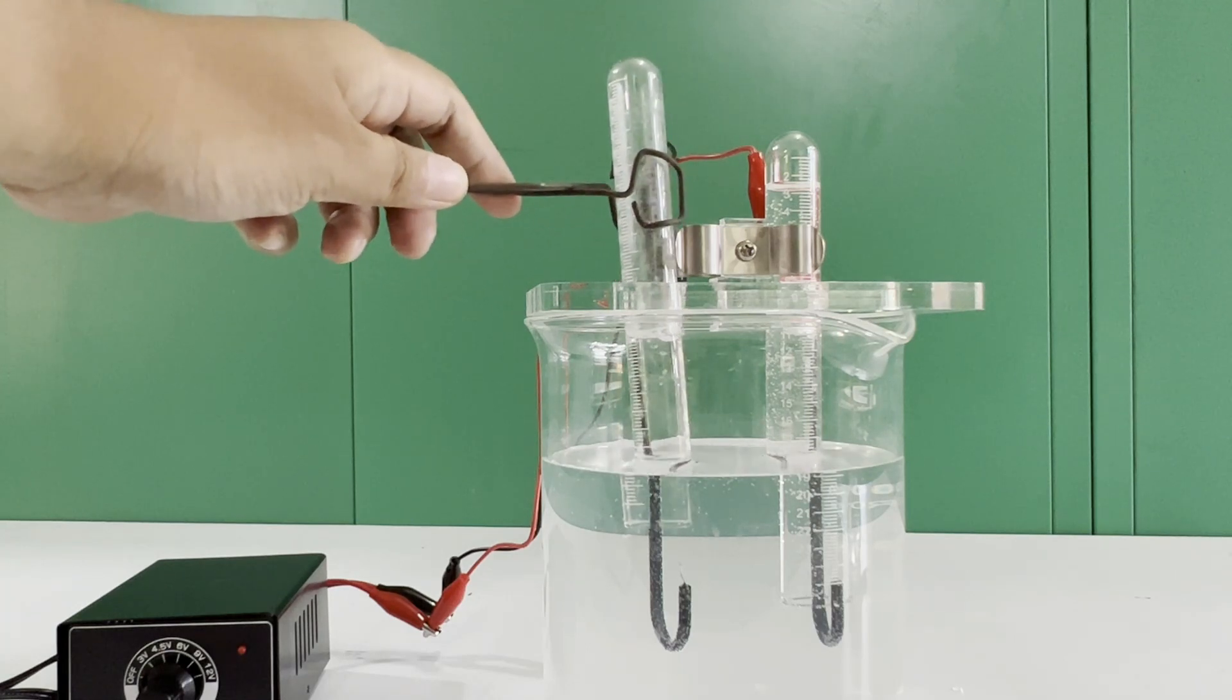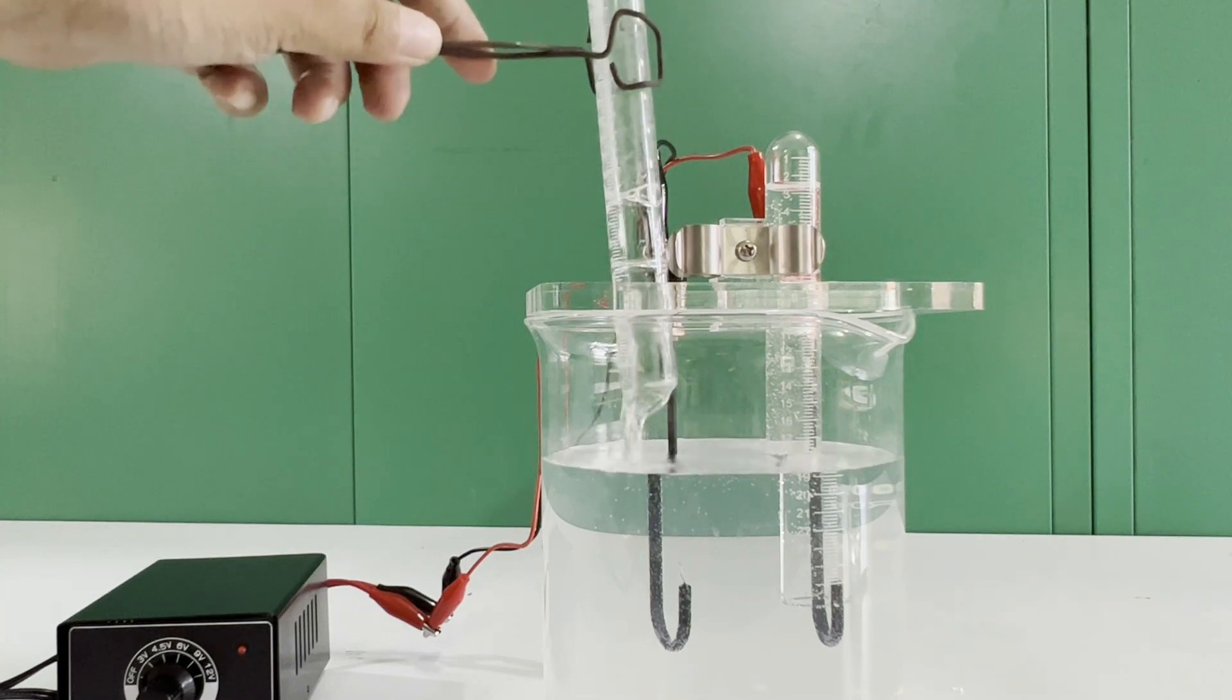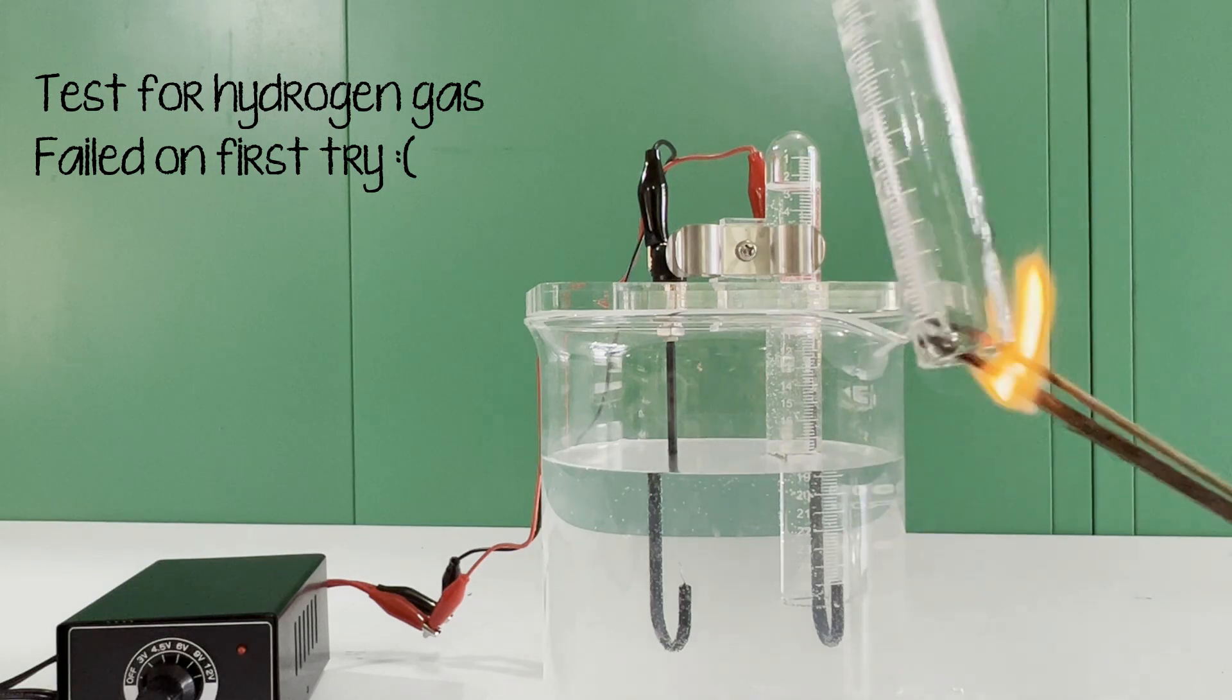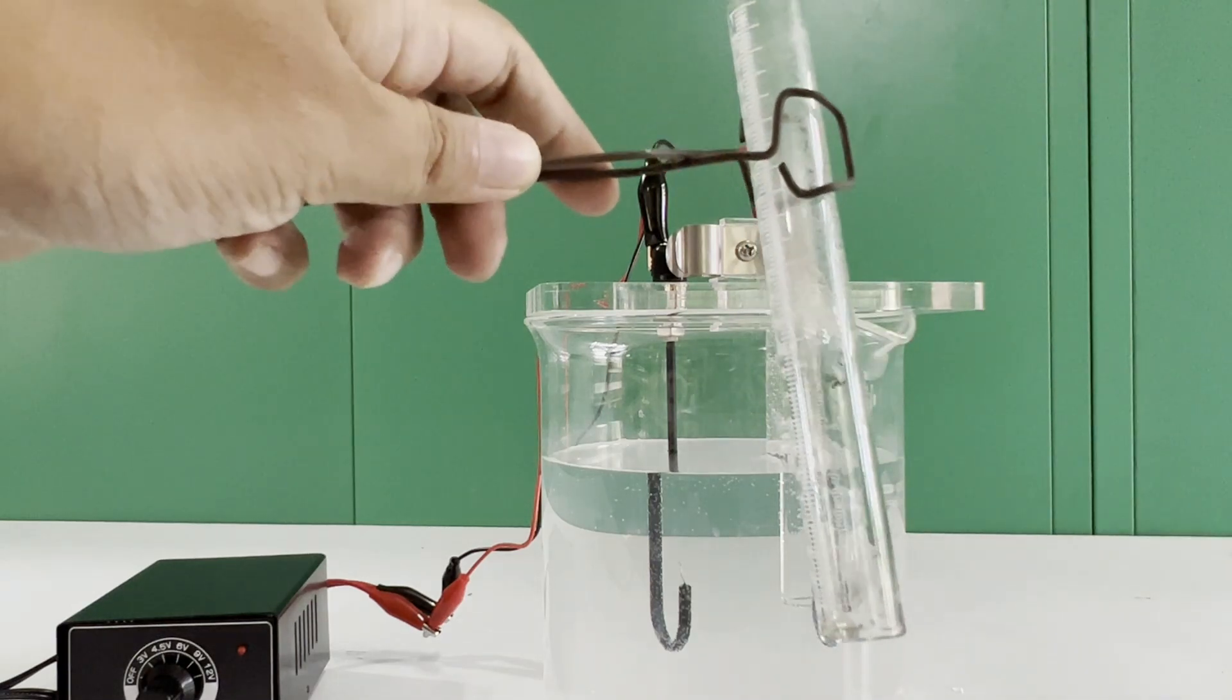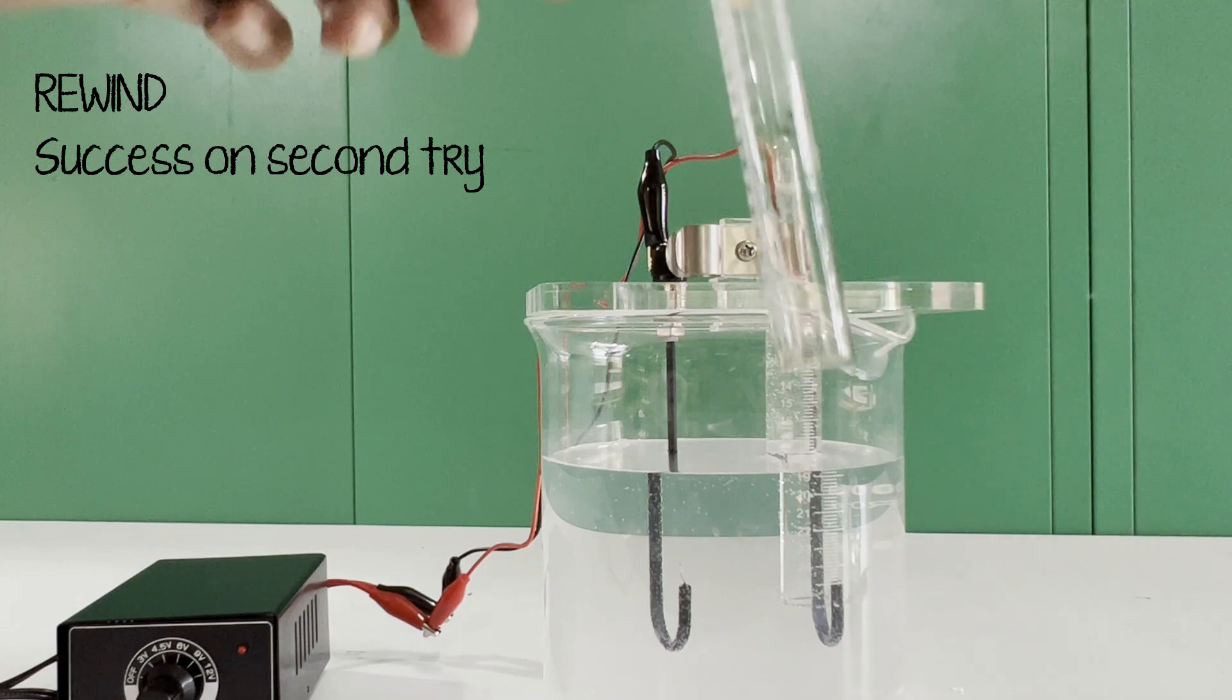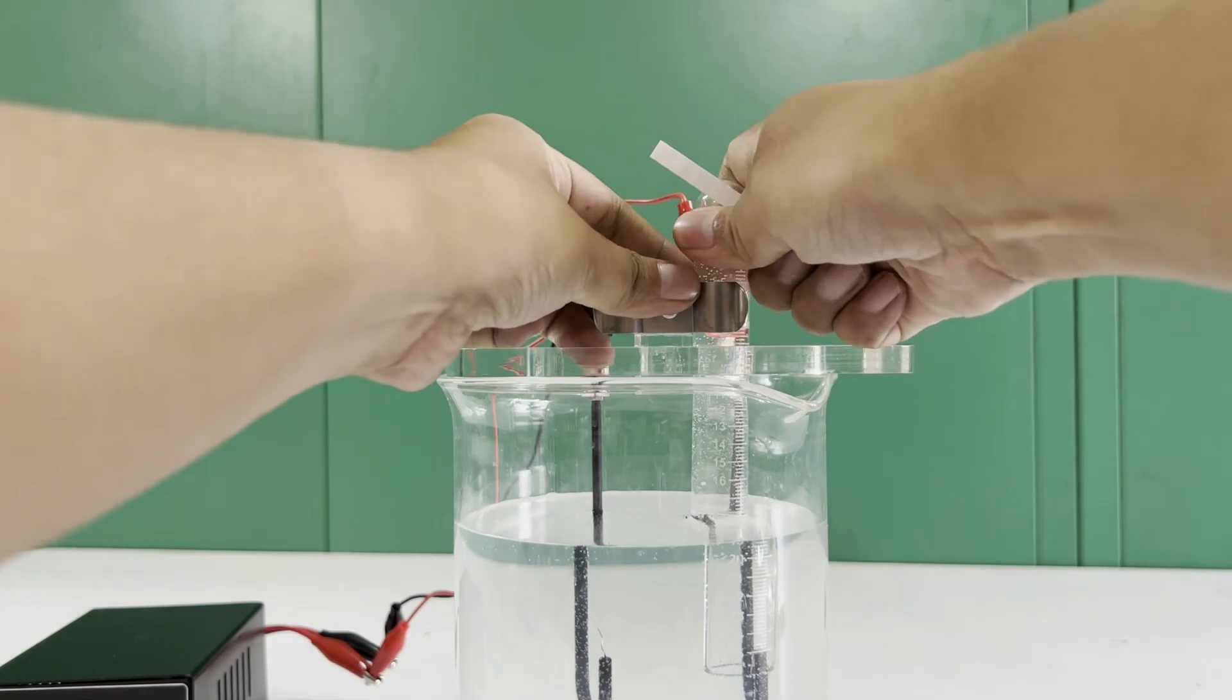Remember, be careful when doing this part of the experiment and make sure you are holding the test tube far from you. Here, I failed in my first try, but succeeded in my second. The popping sound proves the presence of hydrogen gas.